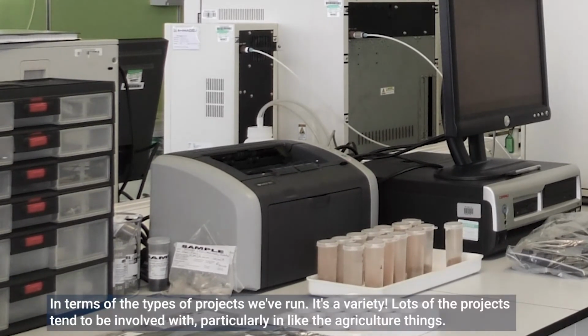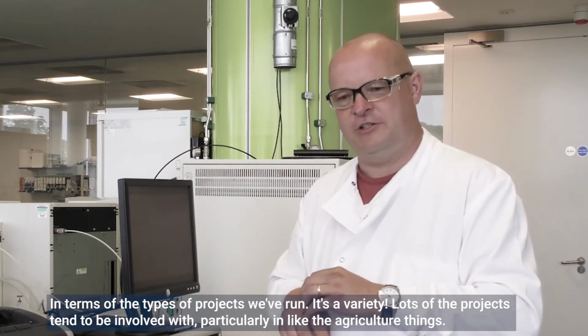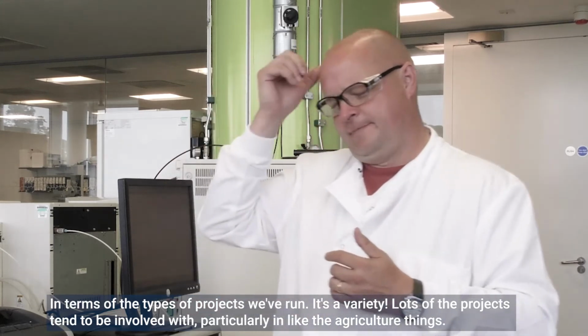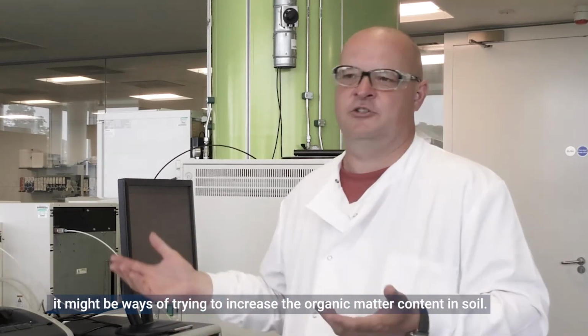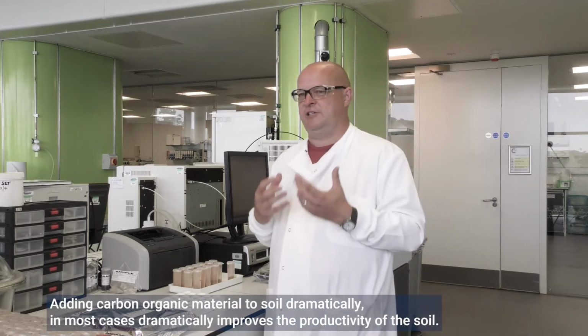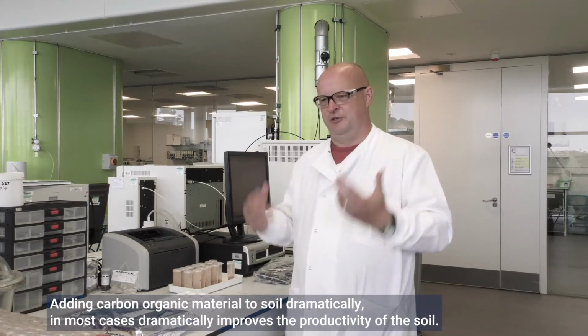In terms of the types of projects we've run, it's a variety. Lots of the projects tend to be involved with, particularly, the agriculture side, it might be ways of trying to increase the organic matter content in soil. Adding carbon, organic material to soil, in most cases, dramatically improves the productivity of the soil.